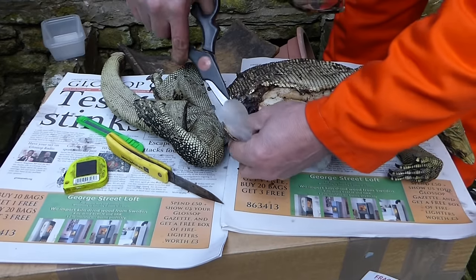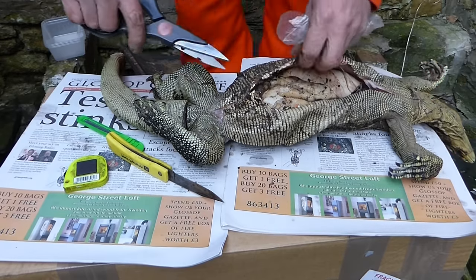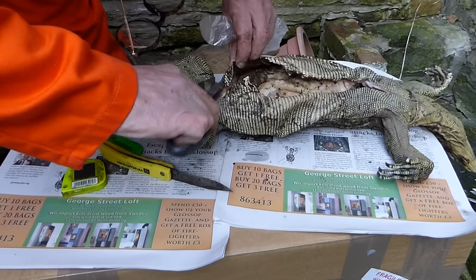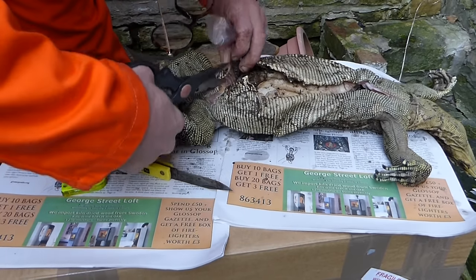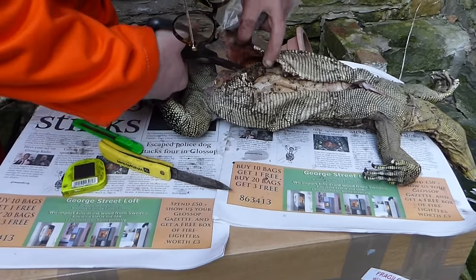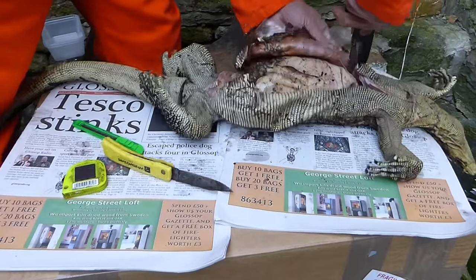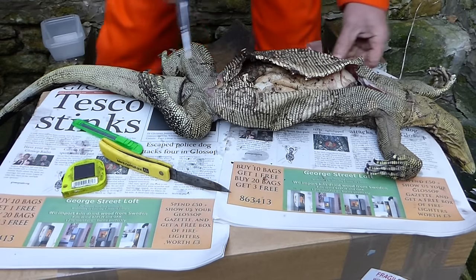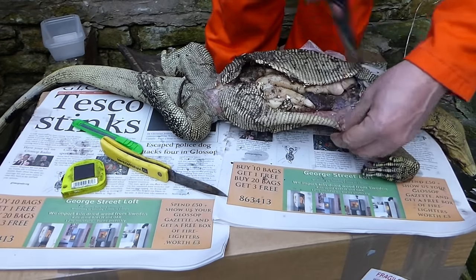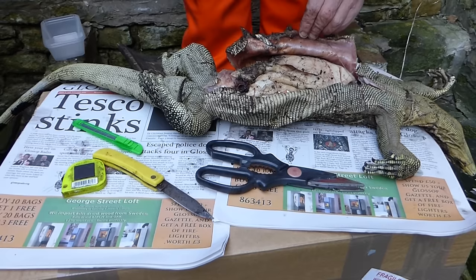This is very dry — you'd probably quite often find these things a lot wetter. Let's do the same with this side. This is a bit of a mess in here. We can make a handbag after this — I've made a right pig's ear of it. No matter, it's more or less open. What can we see? Lord have mercy, there's a lot of fat. Do you see all that fat?